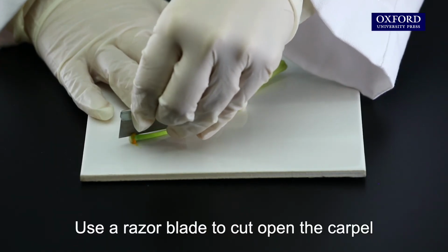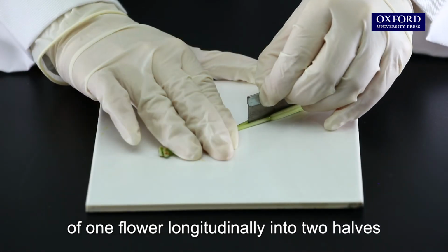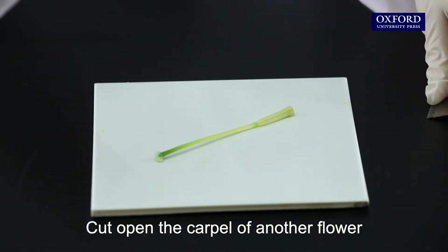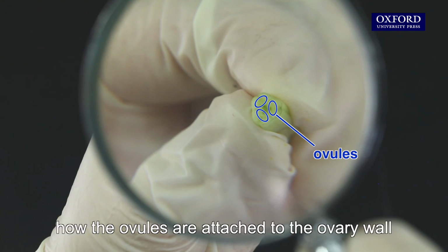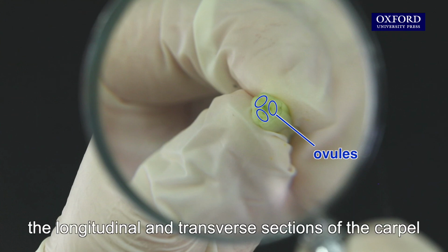Use a razor blade to cut open the carpel of one flower longitudinally into 2 halves. Cut open the carpel of another flower transversely near the center. Use a hand lens to examine how the ovules are attached to the ovary wall. Draw labeled diagrams to show the longitudinal and transverse sections of the carpel.